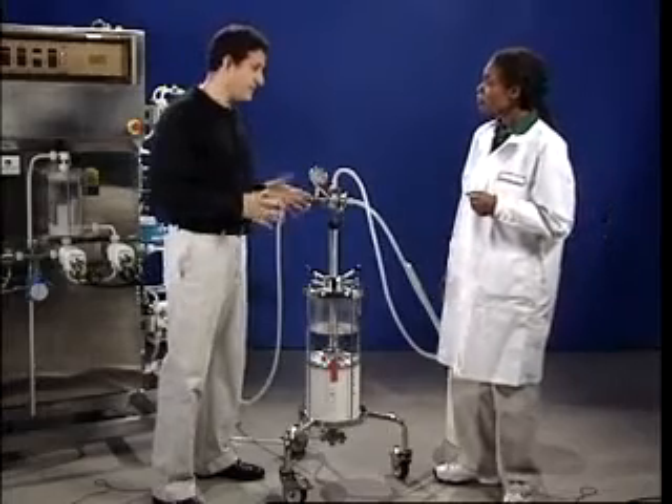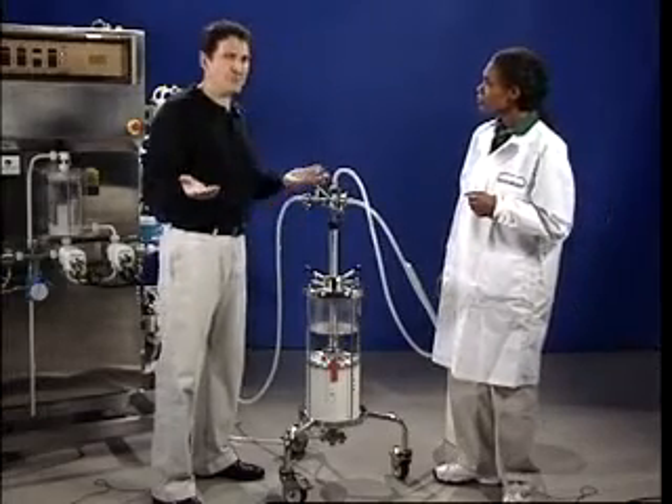What about when things go wrong? If you were not able to get the adapter down to the line in the second step, you can add a third step by simply repeating the second. If you can't get it in three steps, start over. Using a 1% sample volume at a testing flow rate of 20 to 30 centimeters per hour, we should expect at least 4,000 plates per meter with an asymmetry between 0.8 and 1.5. You might want to review the recommended testing procedures and variables in the evaluation section of this CD before you begin testing.